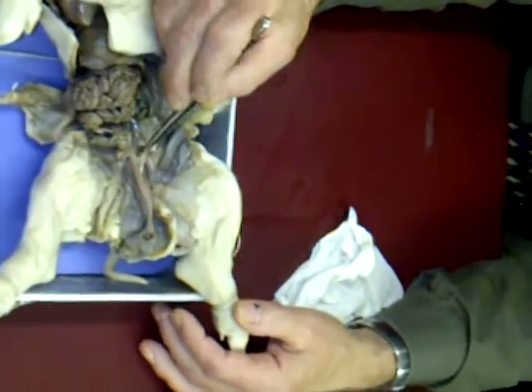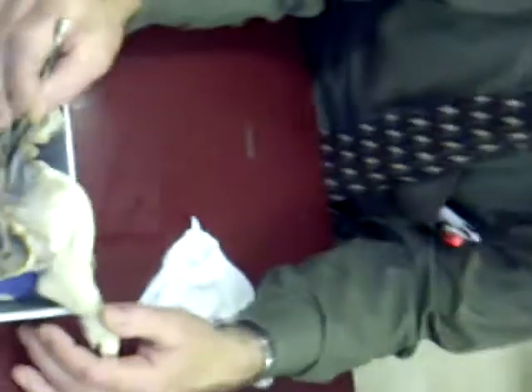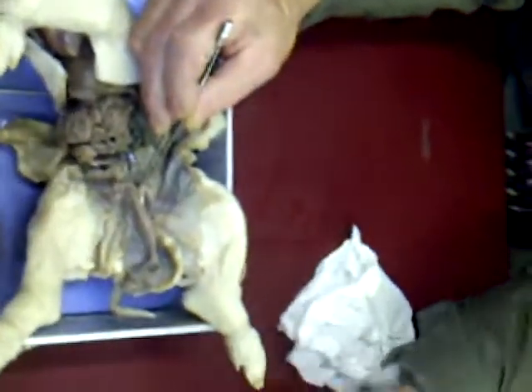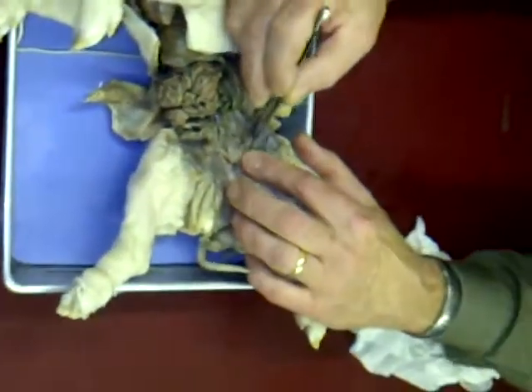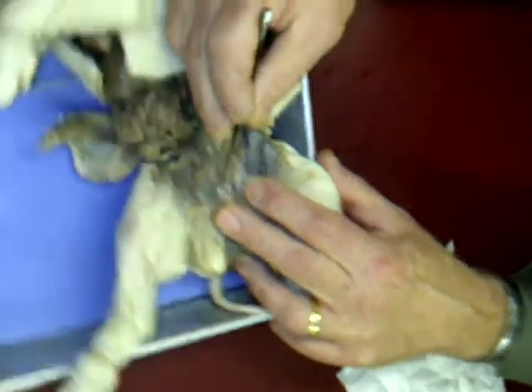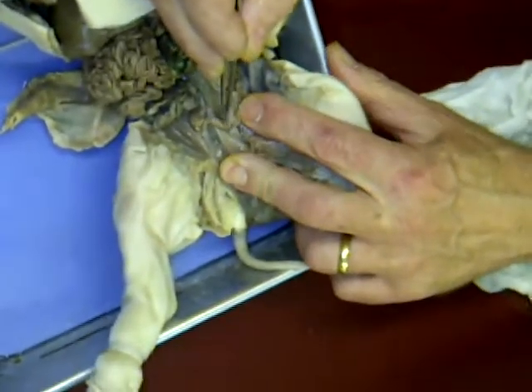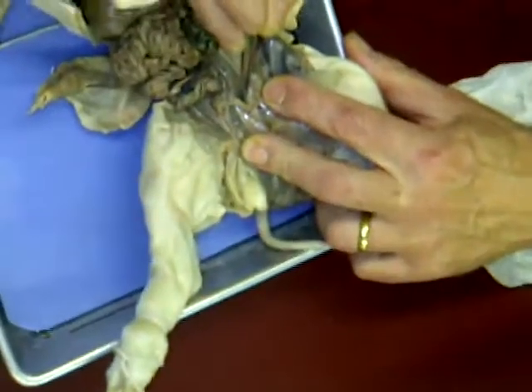actual uterus. Will differentiate into a functional uterus way down the line. You see now where the two of them come together, that will become what's called a common uterus. In our species, we just have one common uterus. We don't have uterine horns on the left or right. And then that leads into the top of the vagina. See how you have, here's the uterine horn on the right, here's the one on the left looking from the dorsal surface. You see how they come together there? That is the top of the vagina.